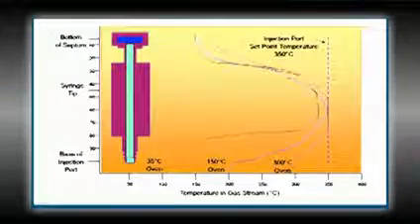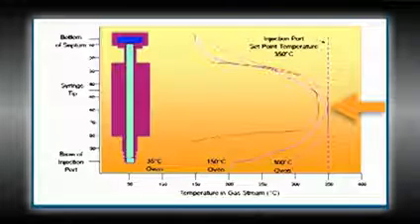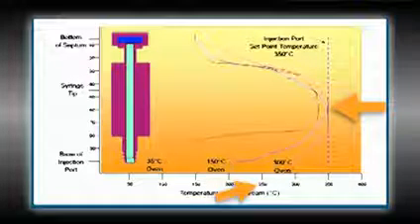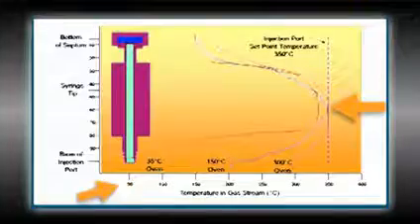And the image we're looking at here is the temperature profile of a typical injector versus the oven temperature. As long as the column is hot enough, that vapor will still go and not cause any problems. But if the column is cool, it's possible for that vapor to now collect and trap on the front of the column. Now, as long as that's a low concentration, you probably won't see anything. But as you fortify this condensed sample by making more injections, you can get it to a high enough concentration that you'll actually see bonus peaks in every run.